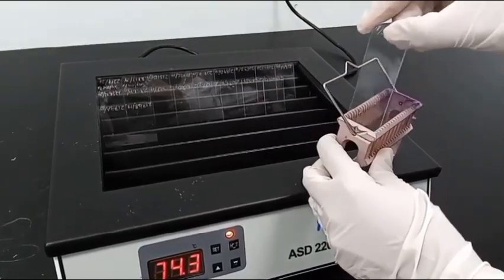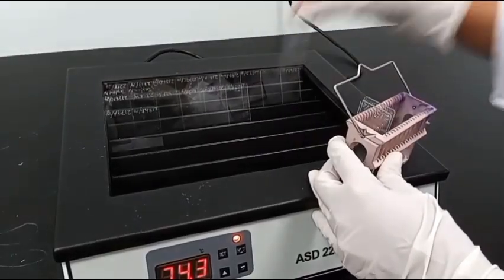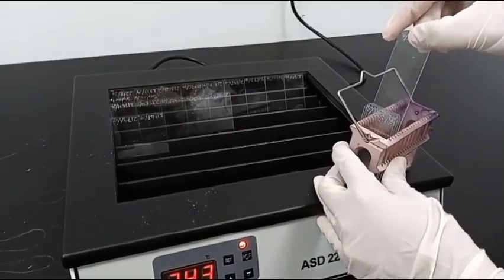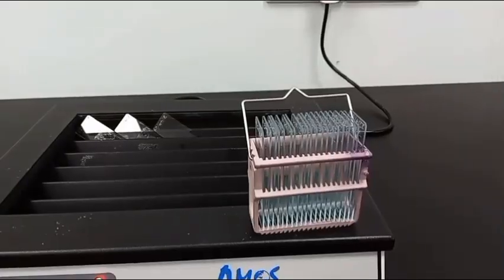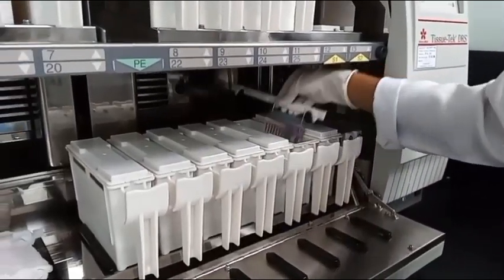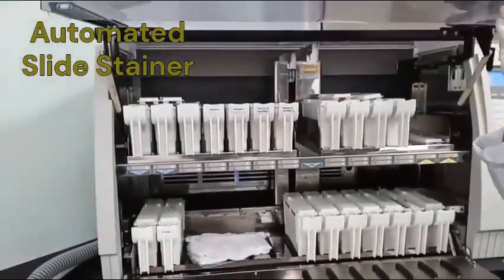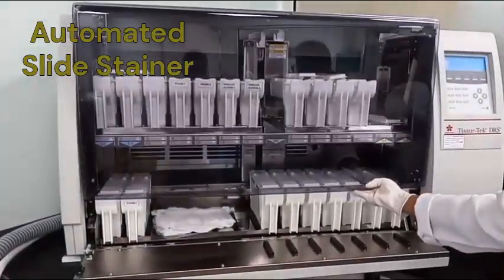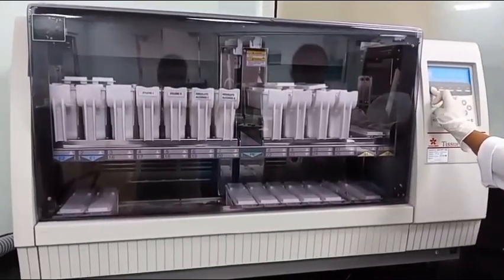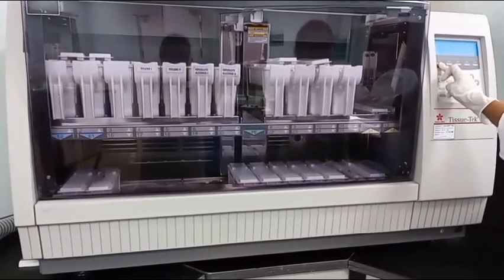Staining. Staining can be done using the automated tissue stainer or manually. Tissue sections obtained from microtomy are transparent and colorless. The purpose of staining is to color cells and thereby facilitate examination under a light microscope. The initial routine stain used universally is the hematoxylin and eosin stain, also known as the H and E stain. It can be used for different types of tissues fixed in different fixatives, as well as cytology smears.